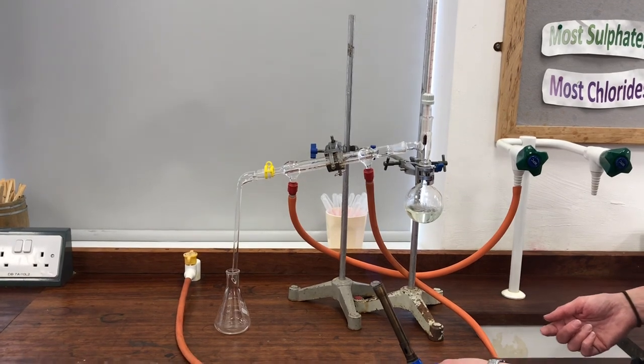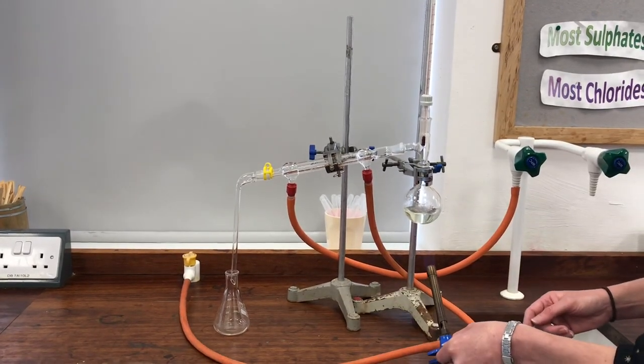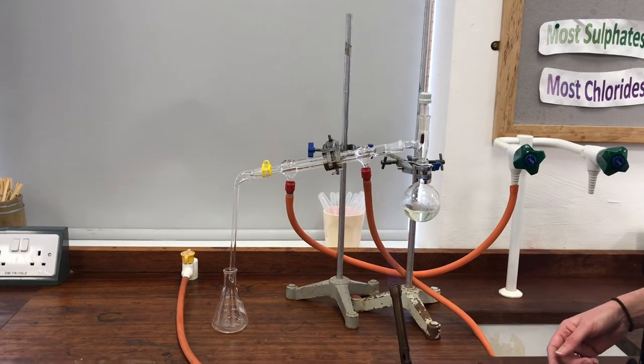And what I can do then is to take my ethanol distillate and I could carry out some tests on it to prove that I've genuinely got ethanol in there.